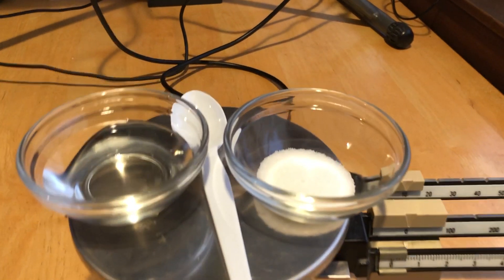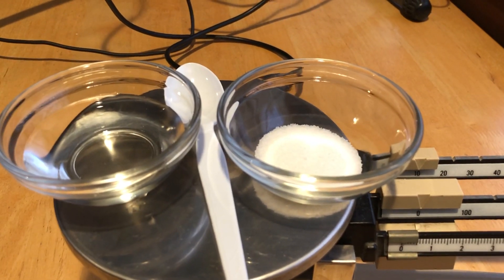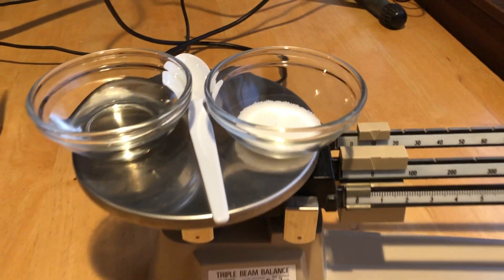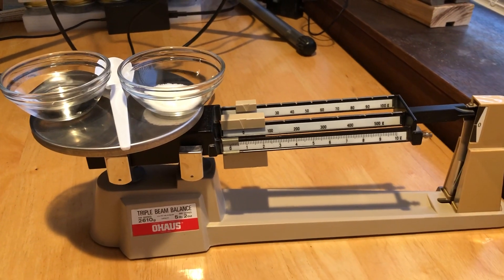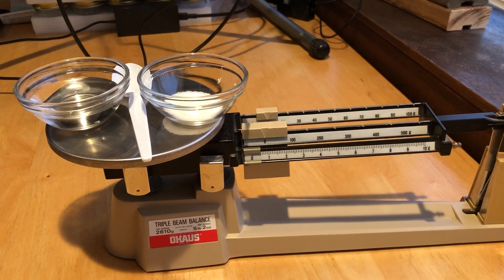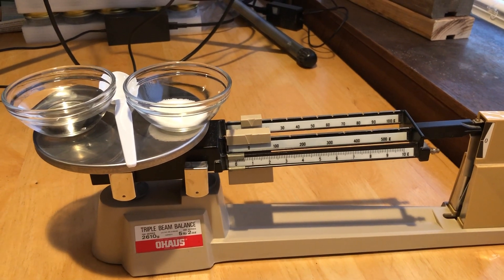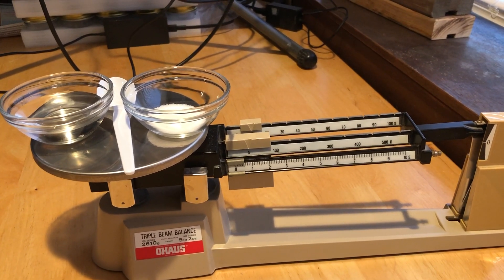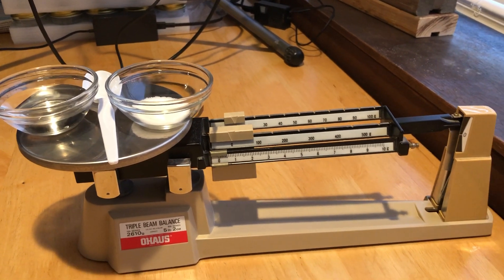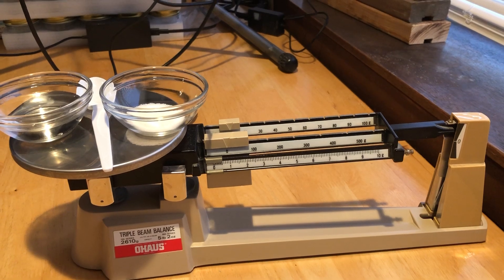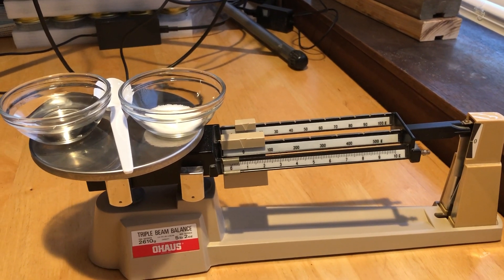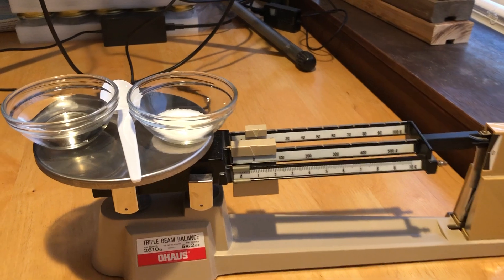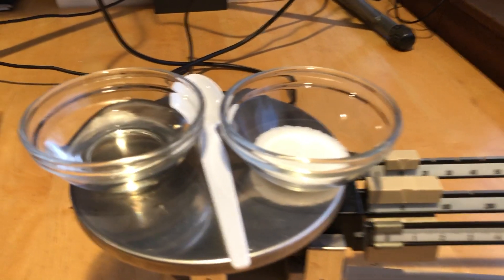and water separated, what's the mass? You should be able to put that on your digital scales easy enough and find what the mass is. You're looking at a triple beam balance right now, so it's a little bit different than your setup, but I can still use this to find the mass.